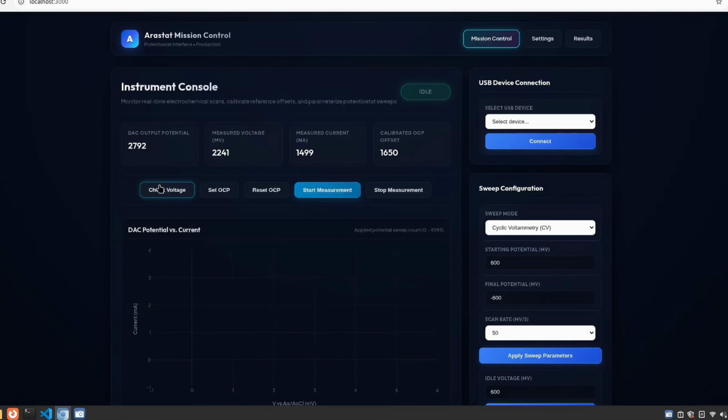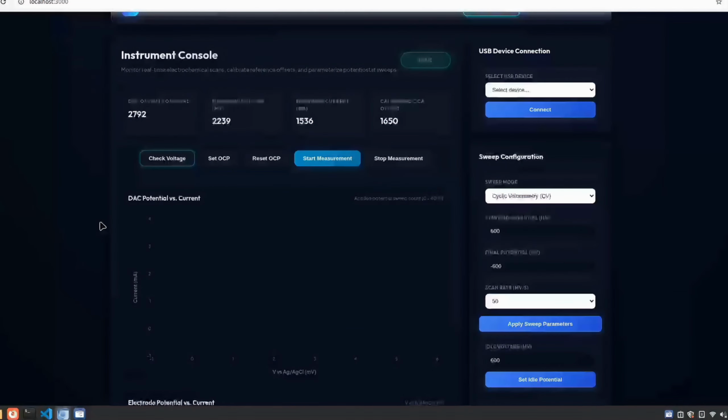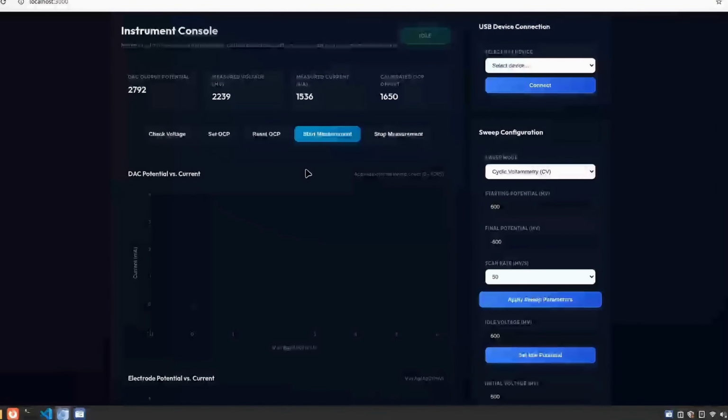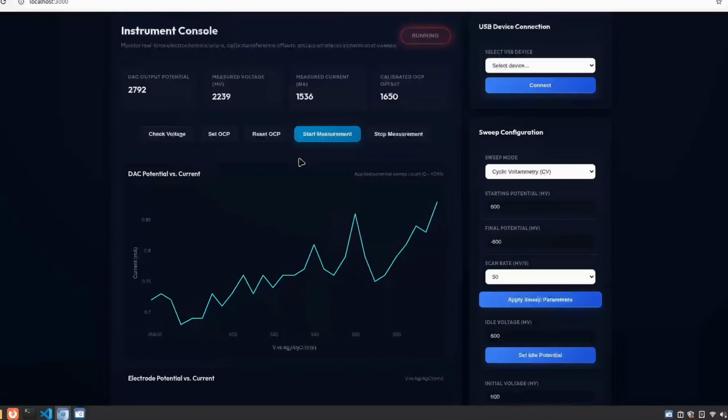Now we check the voltage in the Potentiostat to make sure it's running. The data shown are still raw data, not the calculated one, because it hasn't run yet. The data is shown in the dashboard, not plotted. Now we click Start Measurement to start the measurement. The data is plotted to the graph and it updates the scale as we go.